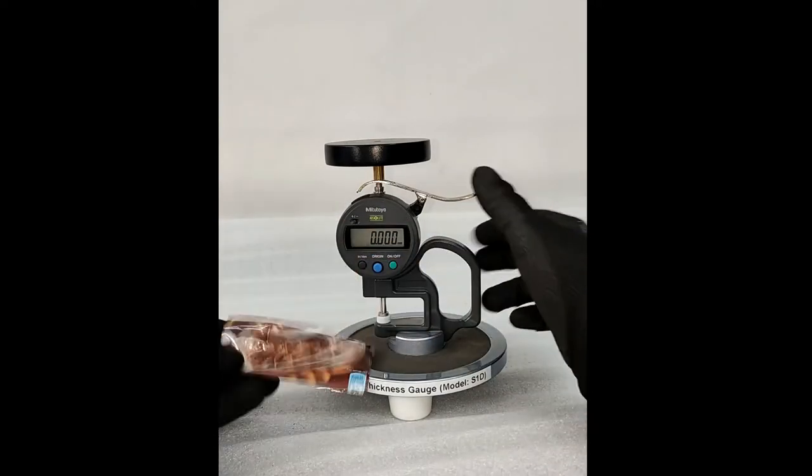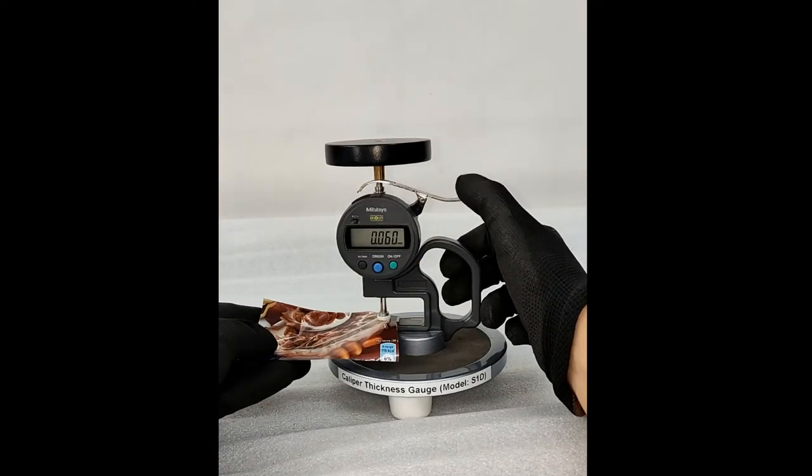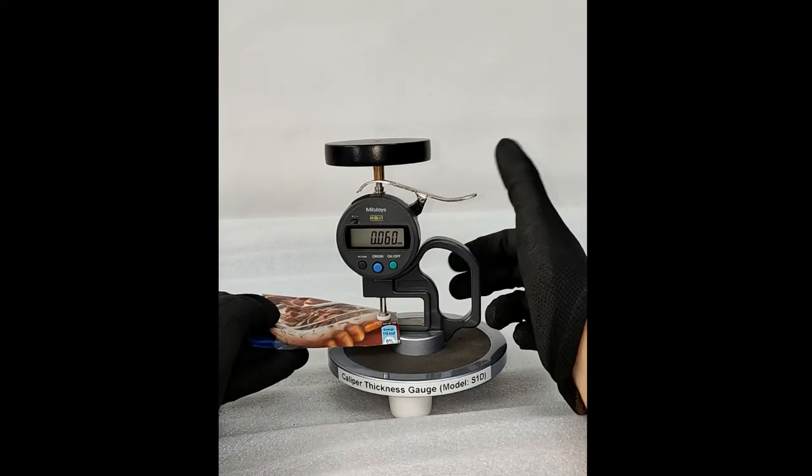Press the lifting lever, insert the sample, and release the lever gently. Note the reading.